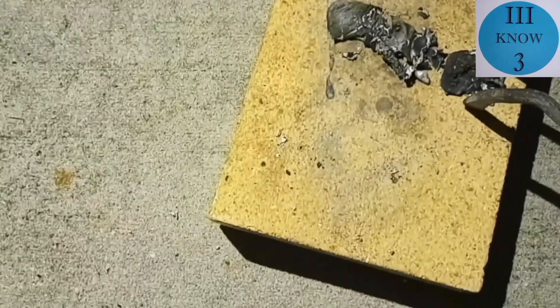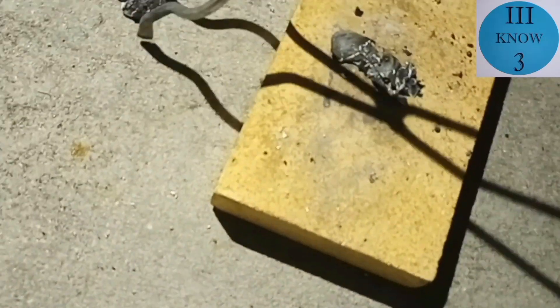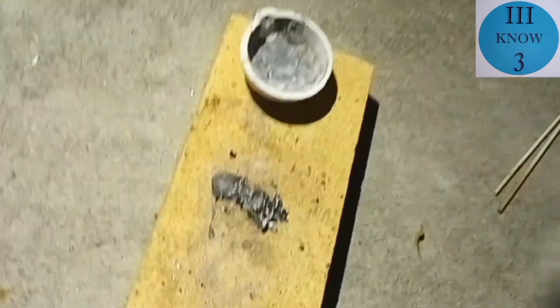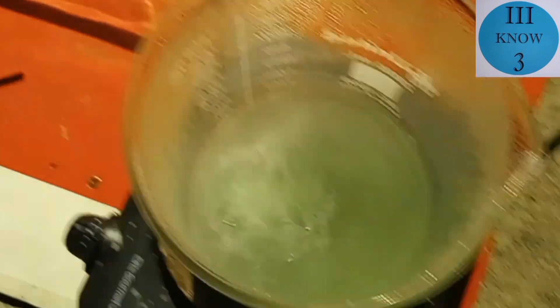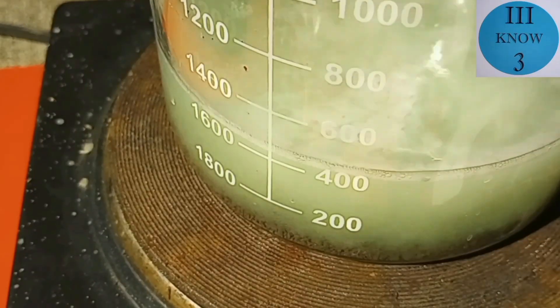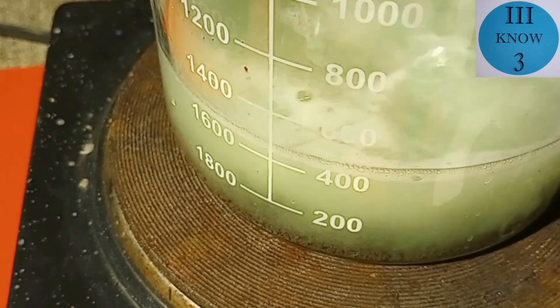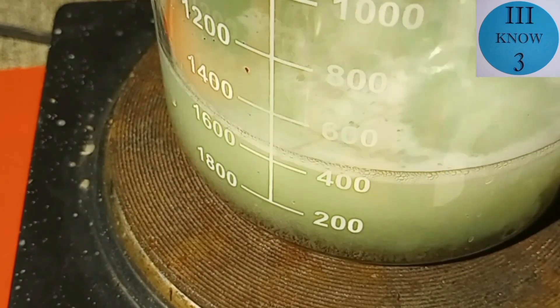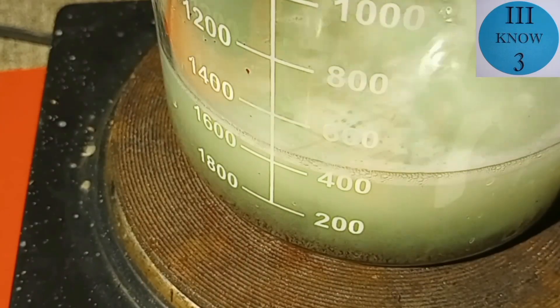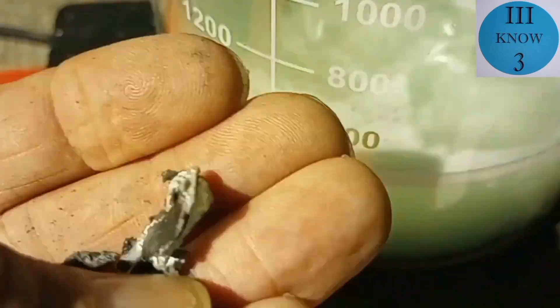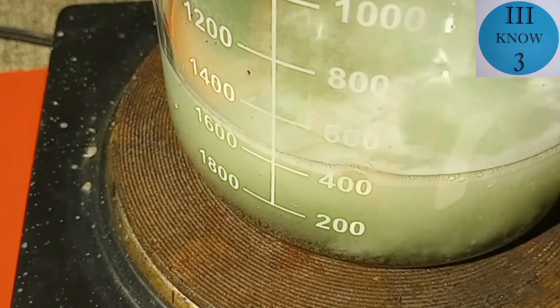I guess we'll have to take the other ones over there too. Come back here. Now that we have them all back into the beaker, I turned the heat back on and we got a pretty good reaction going of the zinc dissolving. Here's the little pieces that I didn't add so I'll go ahead and put those in there now.